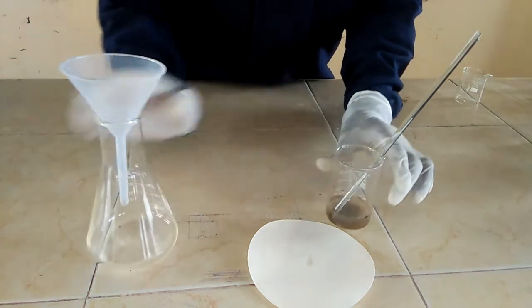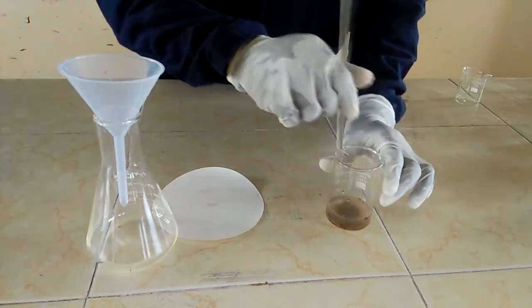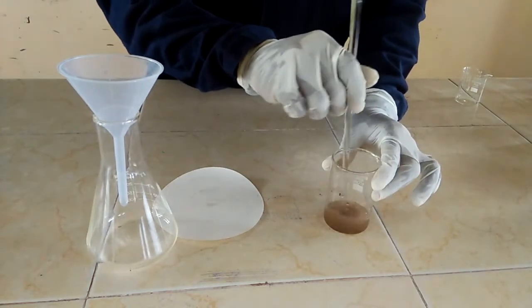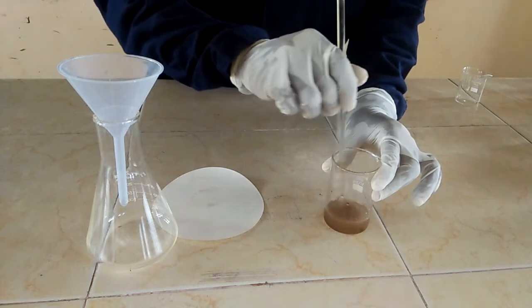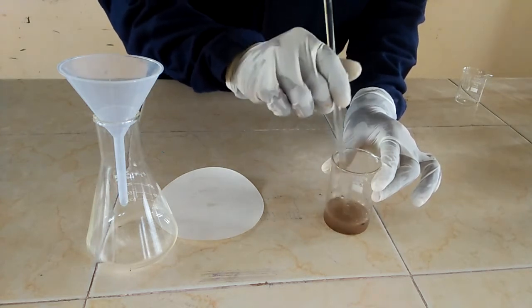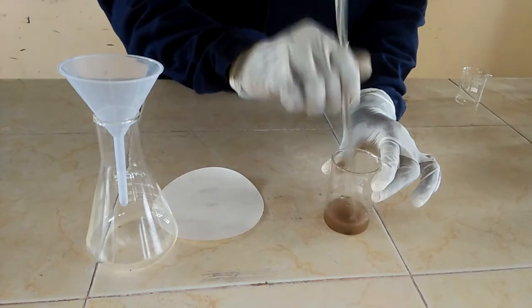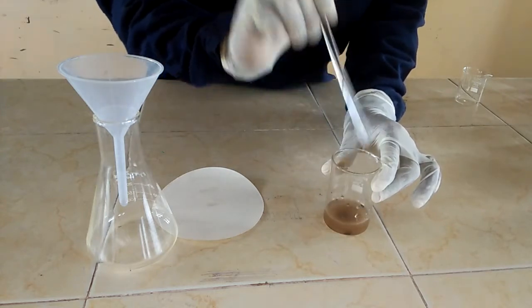With me I have a mixture of soil and water. Our water is dirty — it has suspended particles. The soil is not soluble in water.